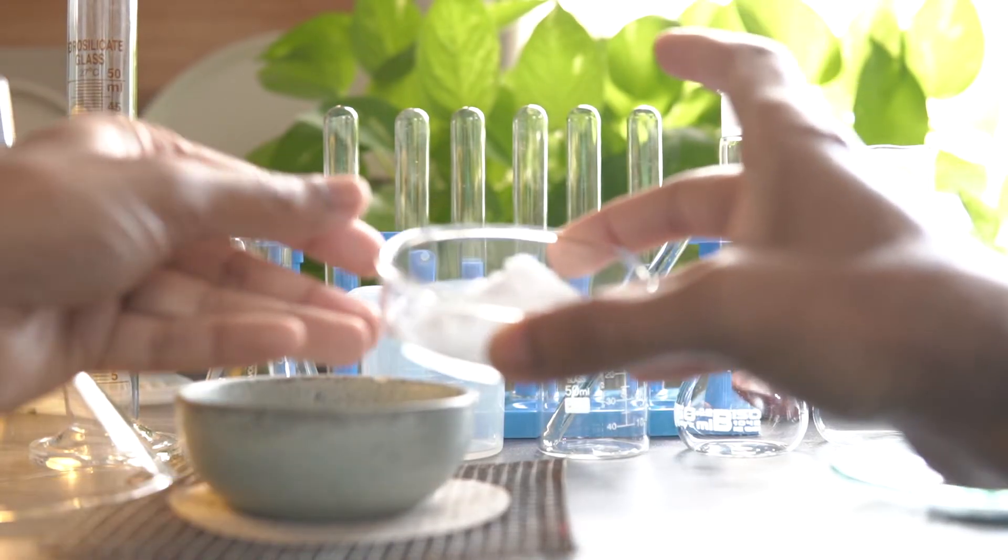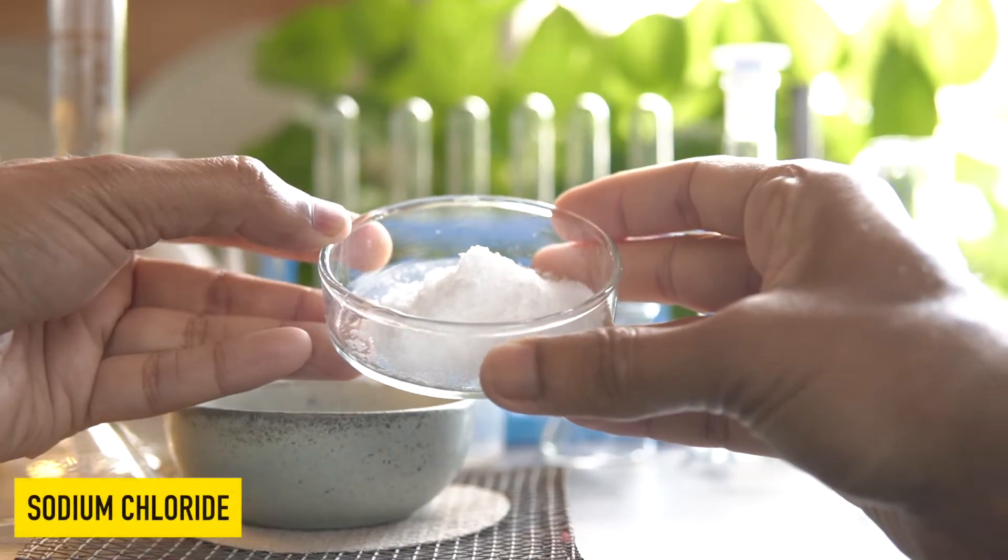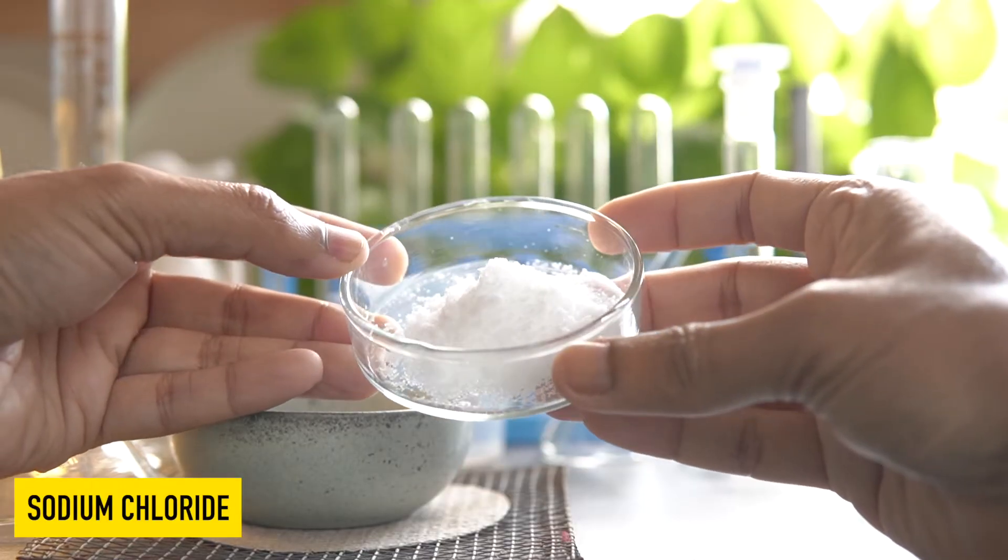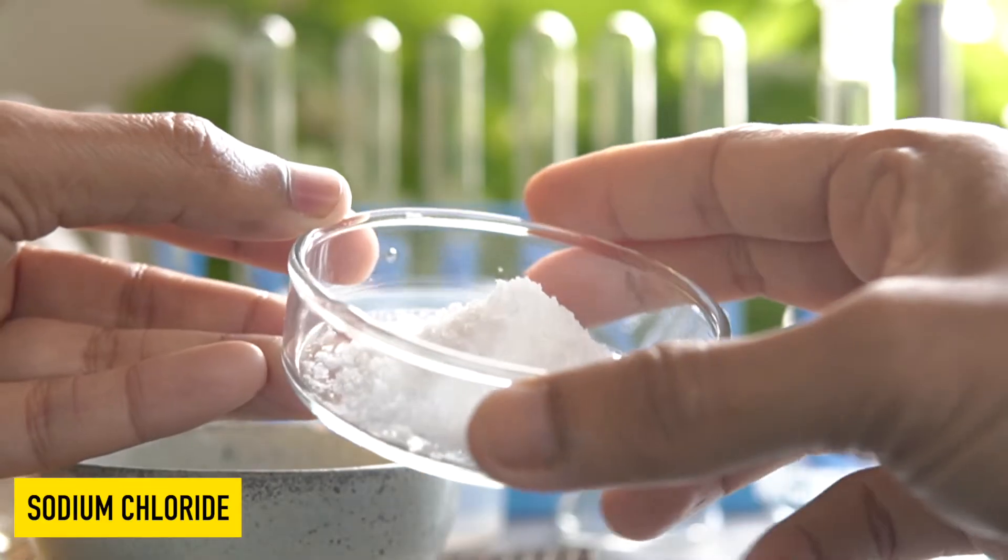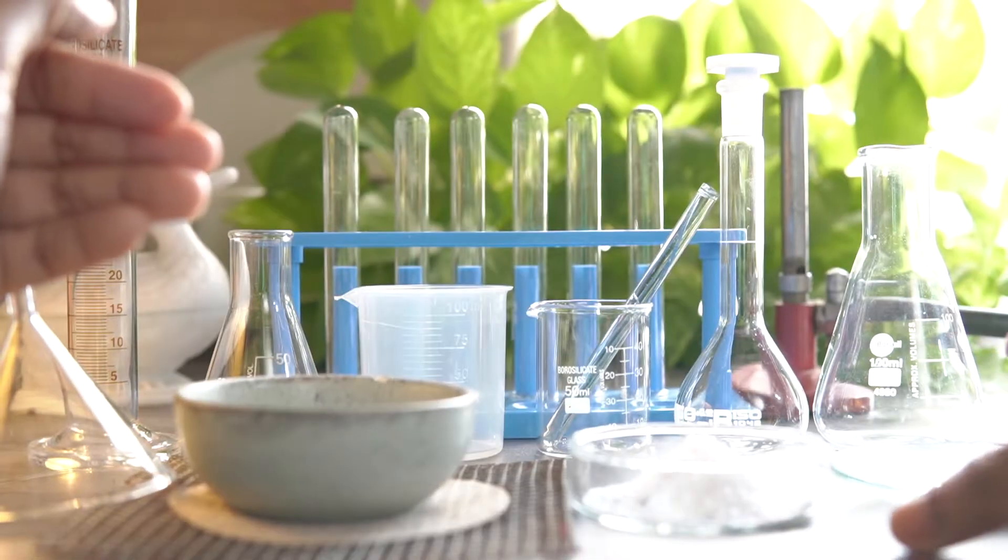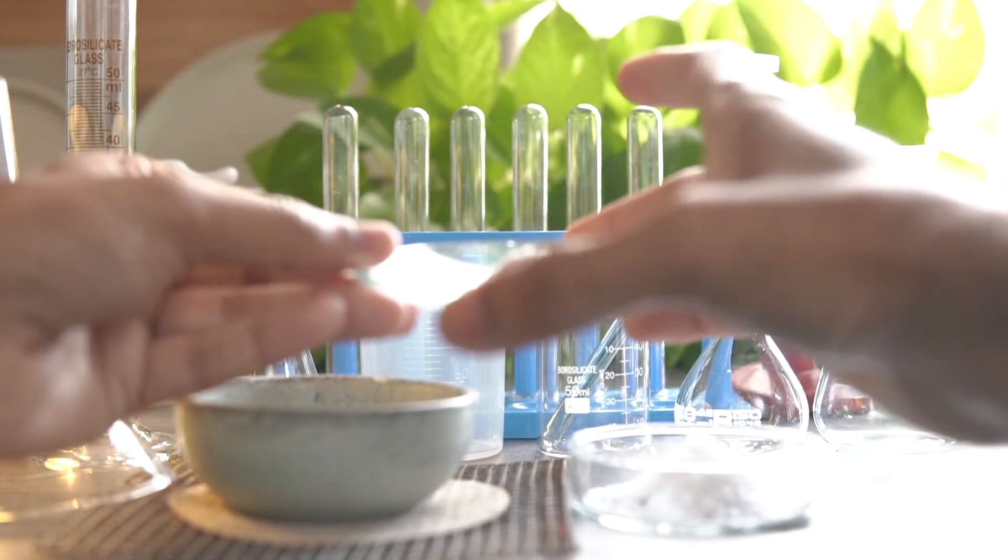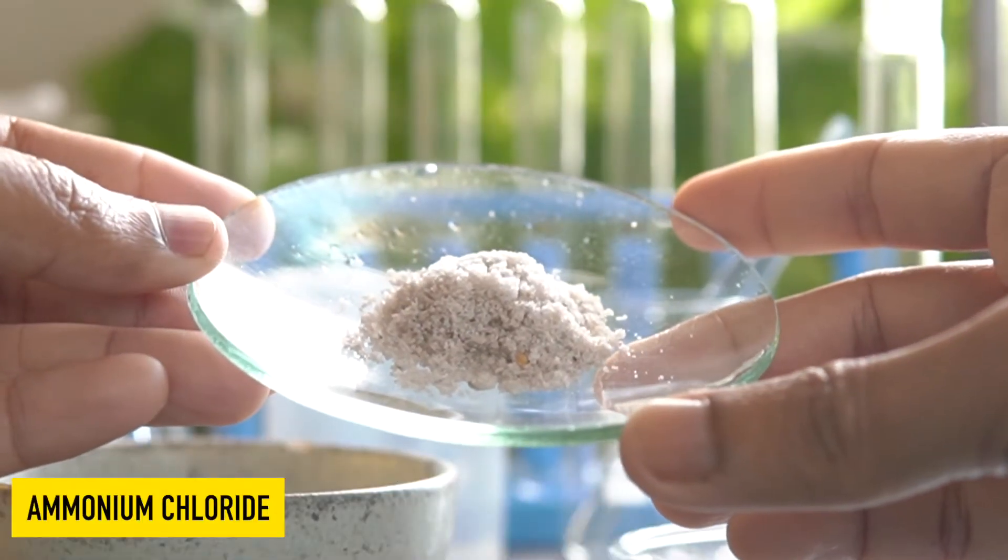The chemical reagents are sodium chloride, white crystalline salt, and ammonium chloride.